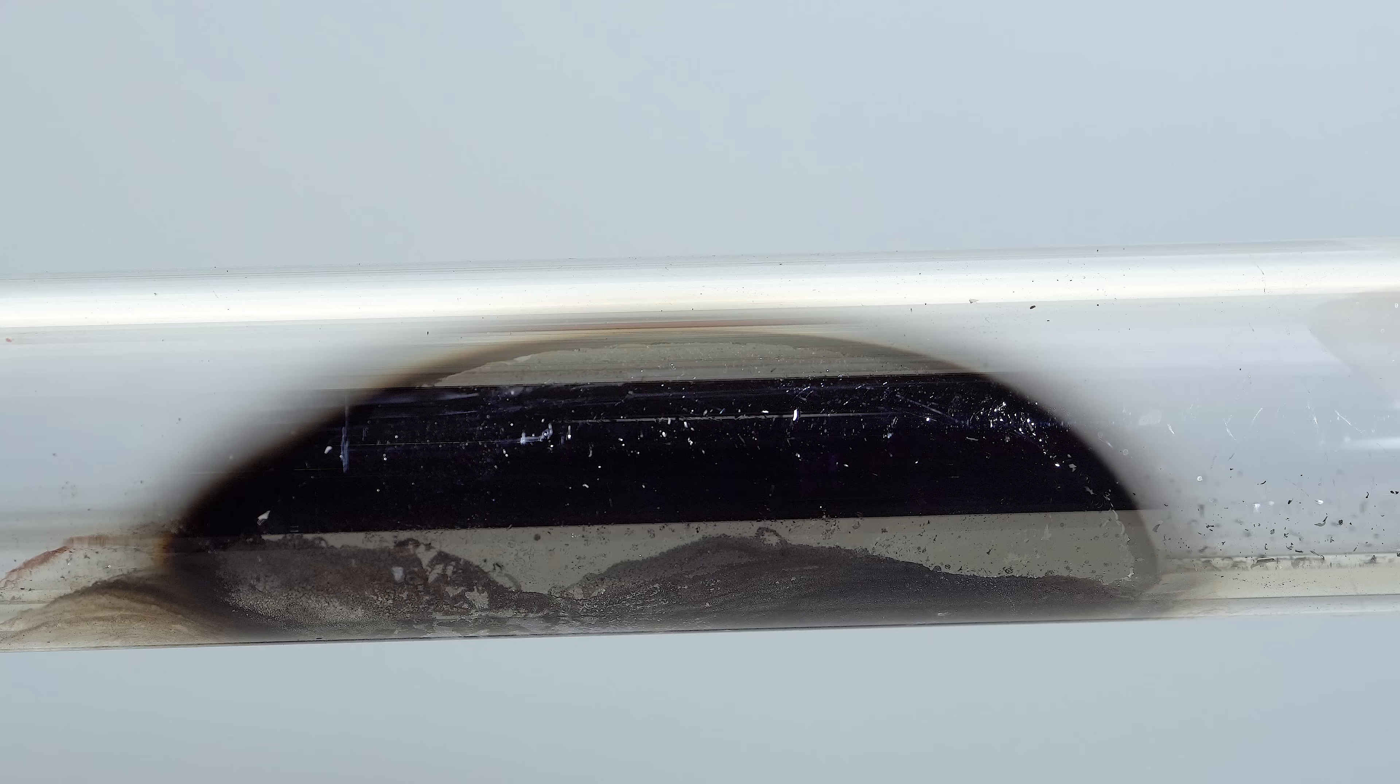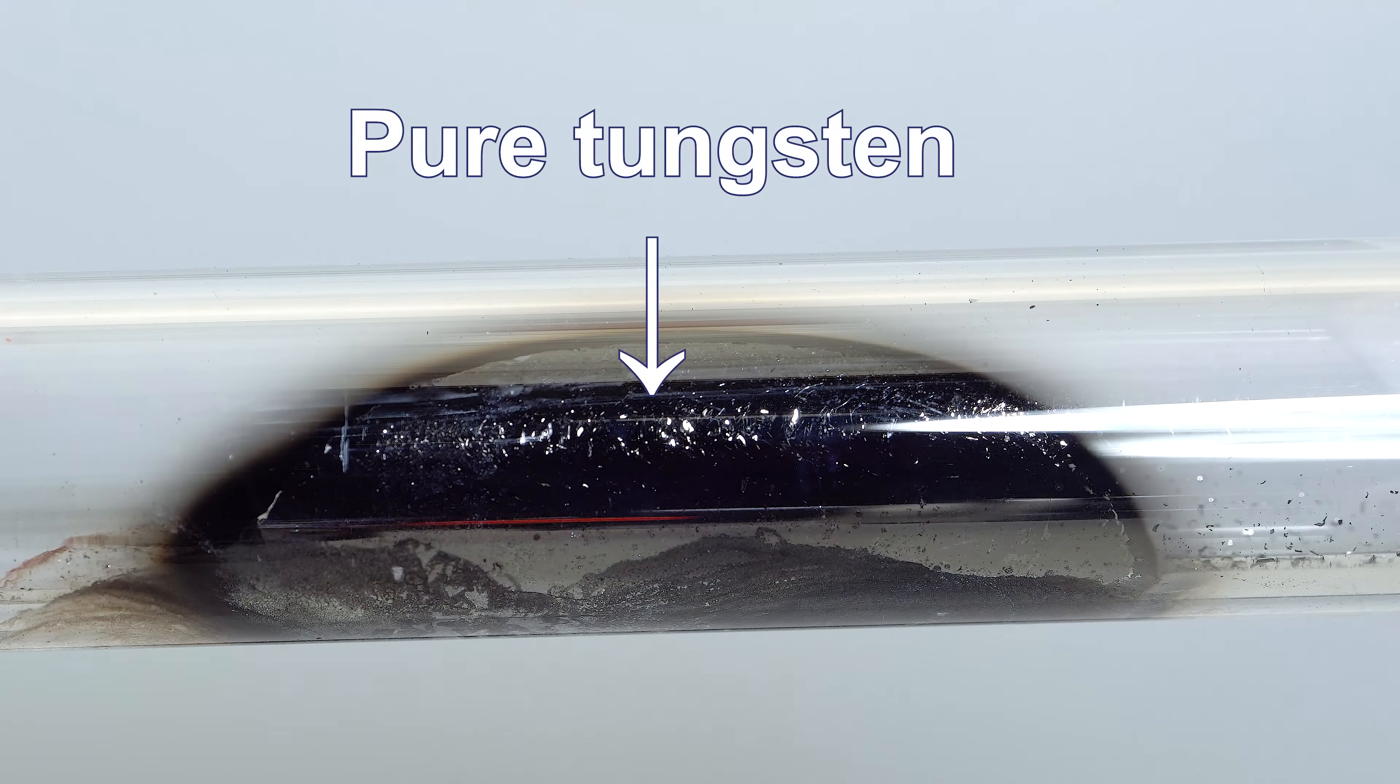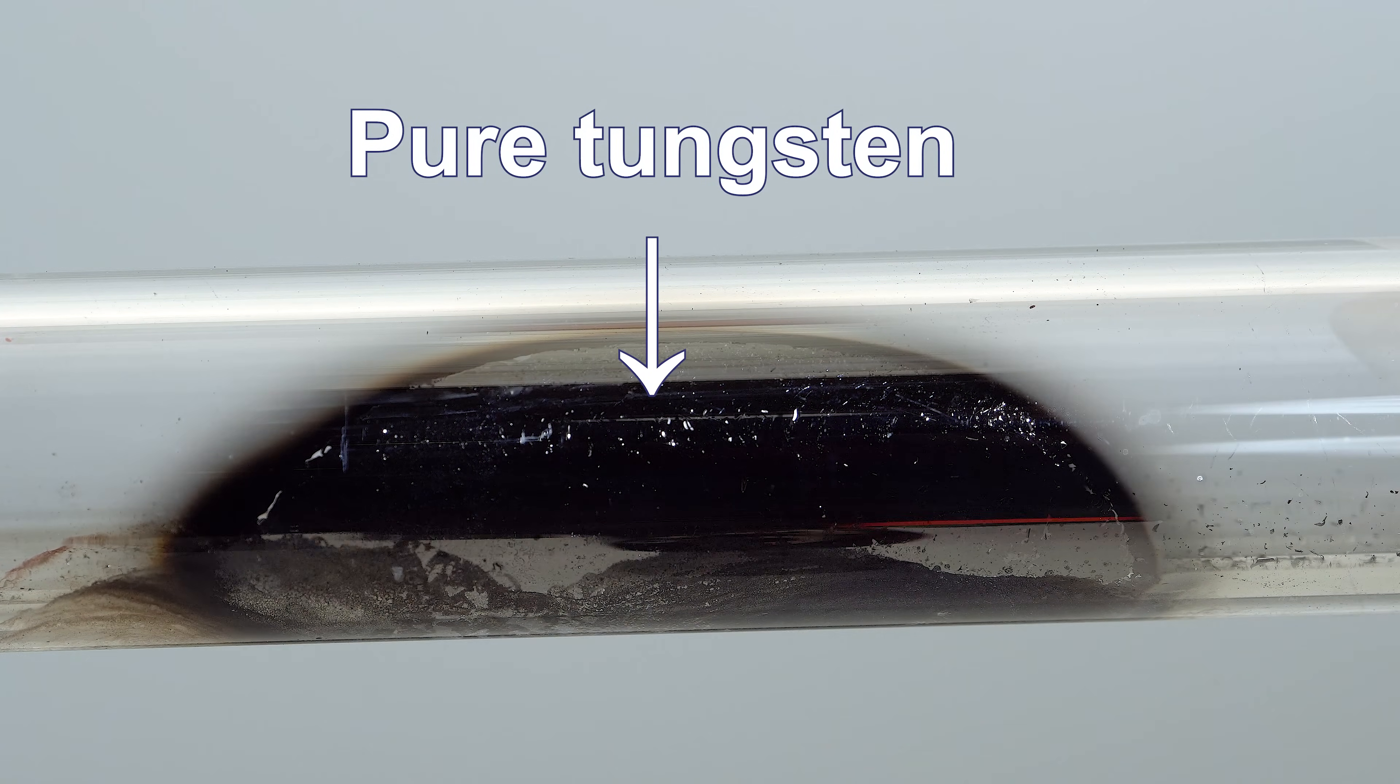After heating when all the tungsten hexacarbonyl has decomposed, we are left with only the tungsten mirror and no additional by-products.